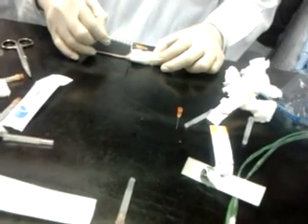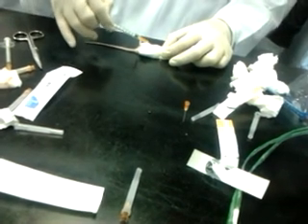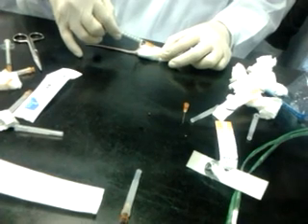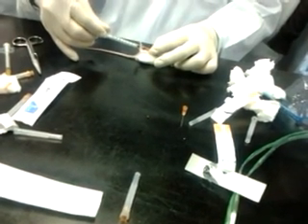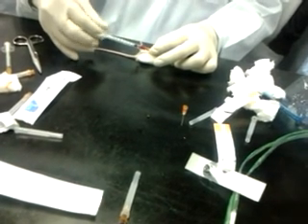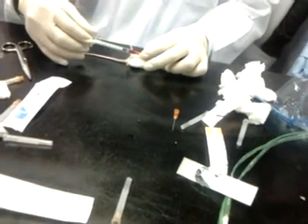See, the heart is somewhere around here. So it's somewhere around here. So we have to place the needle inside. Oh, 0.3. Slowly. You need the heart to be filled rather than you drag in one go. It gets shocked.